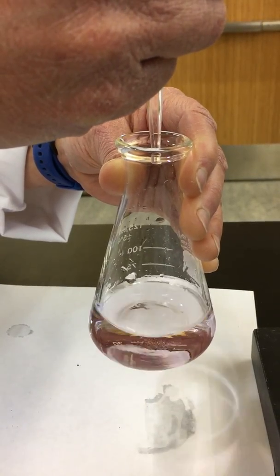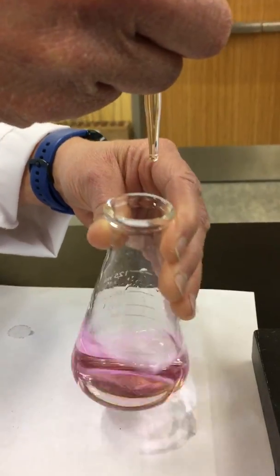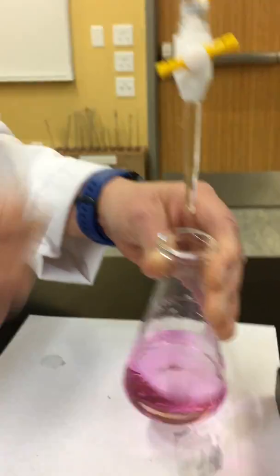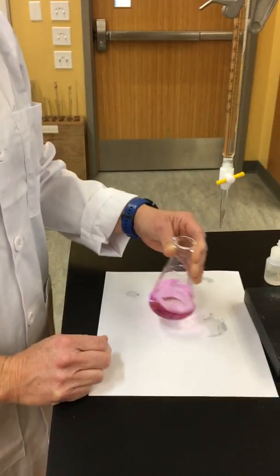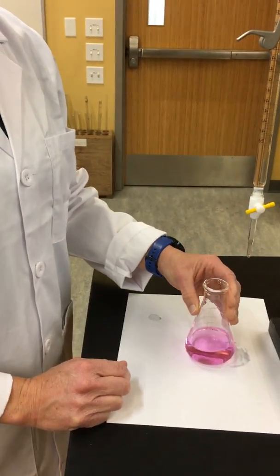One more drop should do it. There we go. That one drop, and we now have that pink color that is not disappearing. We've reached our endpoint of titration.